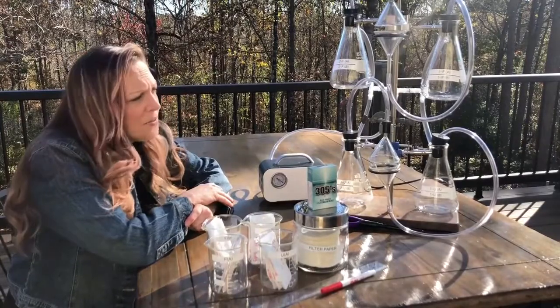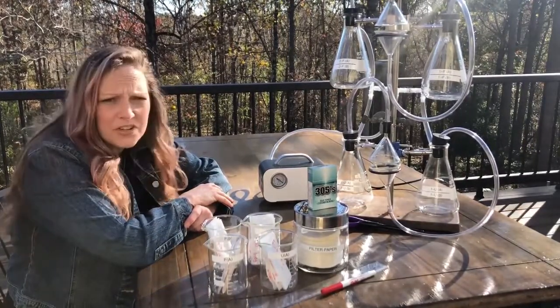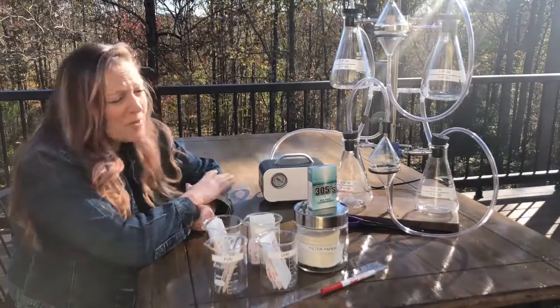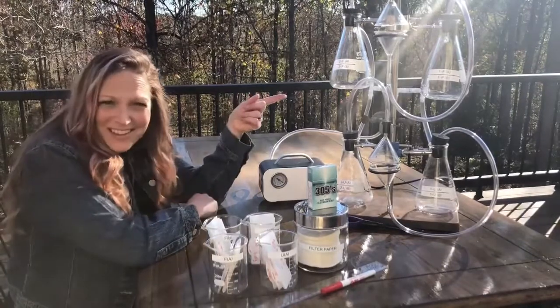Morning, guys. Sorry we had to cancel class for today, but I still wanted to show you all this lab. It's not a live demo, but it's still a demo. I was particularly excited about this apparatus.